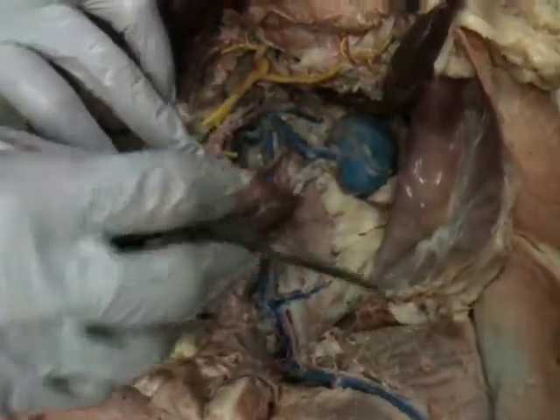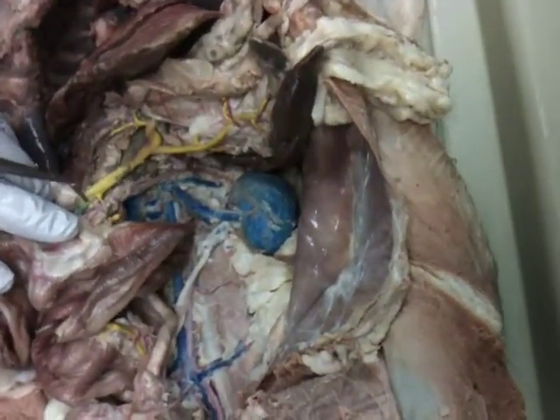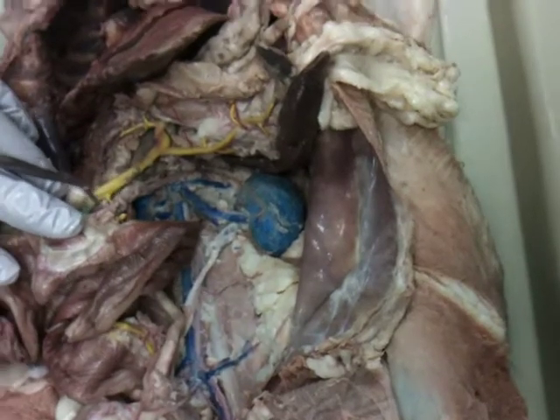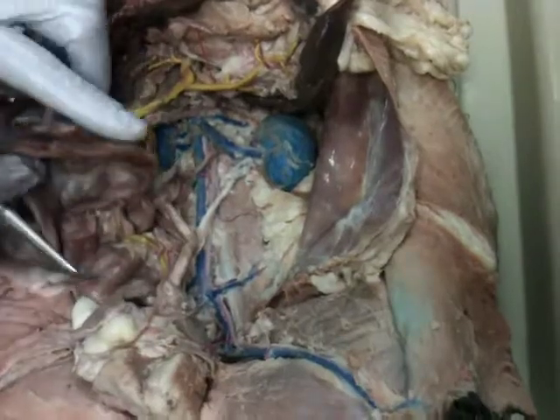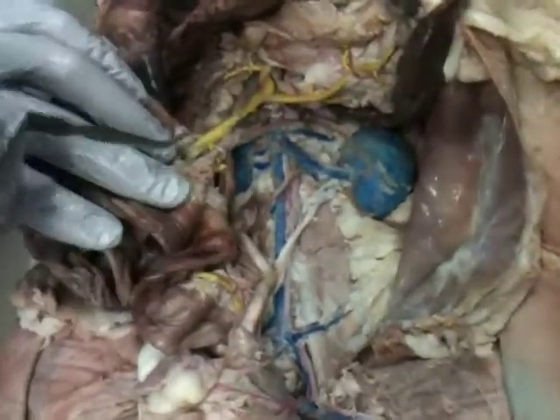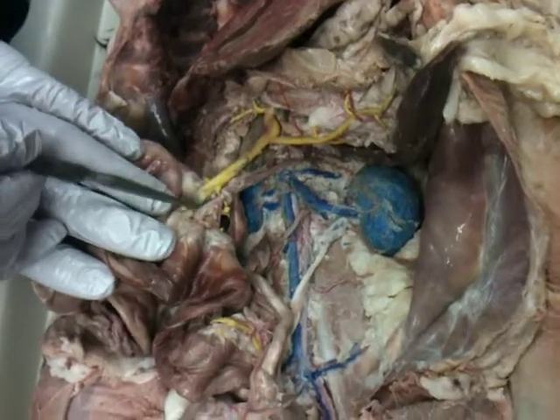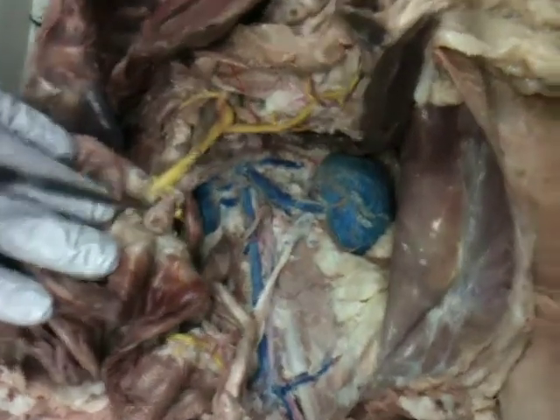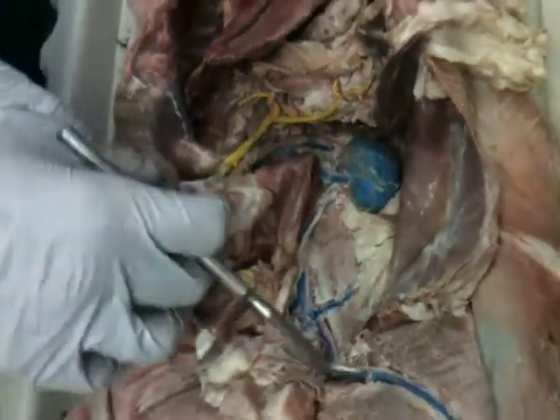Also, in this area, not seen clearly on this one, are vessels that come off here. There's a vessel, that's the ileocolic, and we have one cat that shows it really beautifully. That would go to the ileum, which is the small intestine, and the colon. You can just see it going into the superior mesenteric. Okay, this one's not real clear on this cat, so we'd never ask you on it.